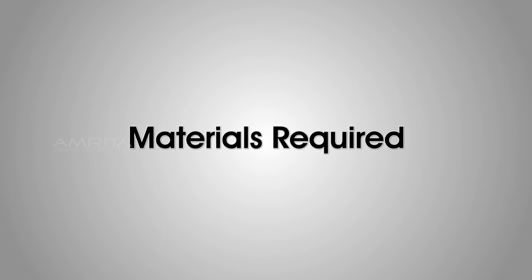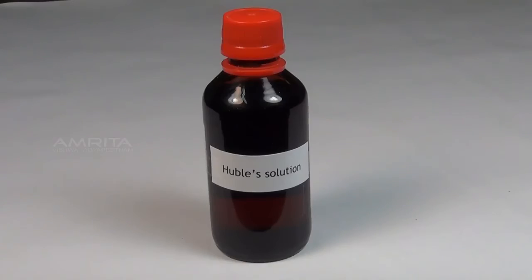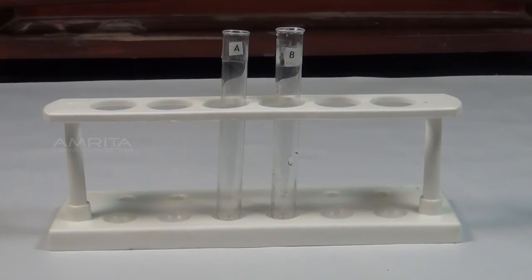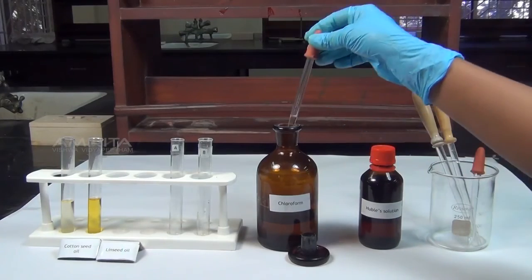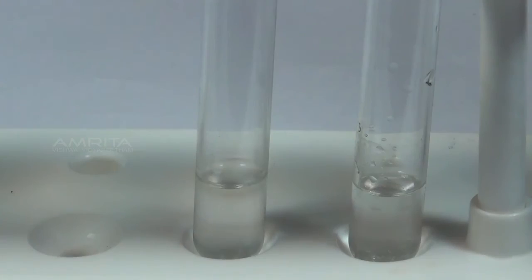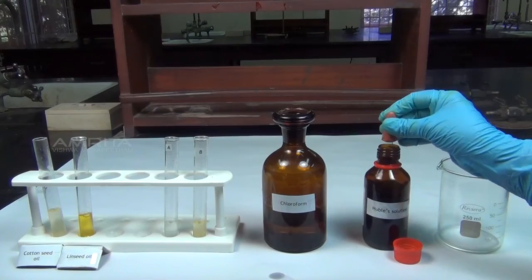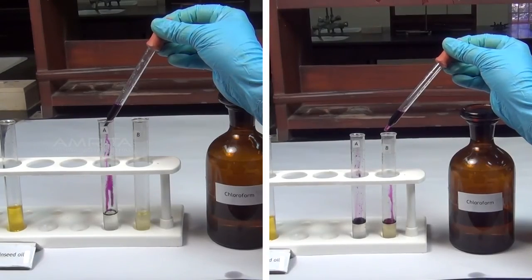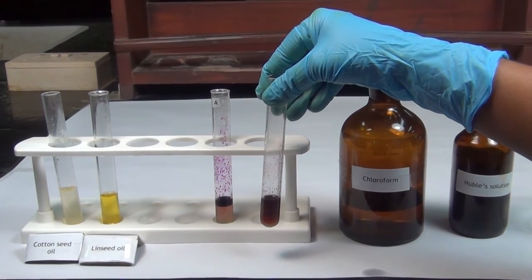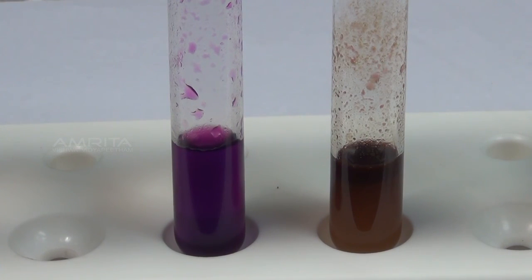Hübl's Test. Materials required: cotton seed oil, linseed oil, chloroform, Hübl's reagent, test tubes and droppers. Take two test tubes labelled A and B. Pour a small quantity of chloroform into each test tube. Then add a few drops of cotton seed oil into test tube A and linseed oil into test tube B. Shake the test tubes well. Now add a few drops of Hübl's reagent to each test tube. The violet colour of iodine in the reagent fades away in test tube B but does not fade in test tube A, indicating that linseed oil is more unsaturated than cotton seed oil.